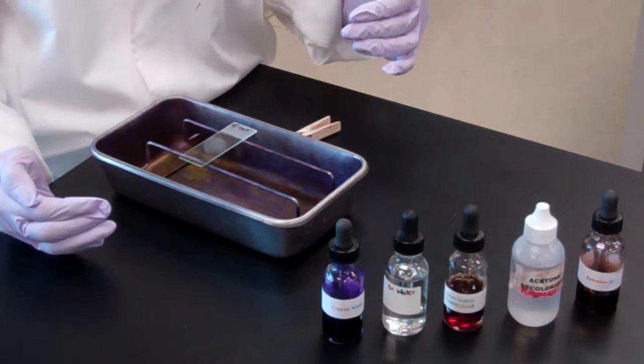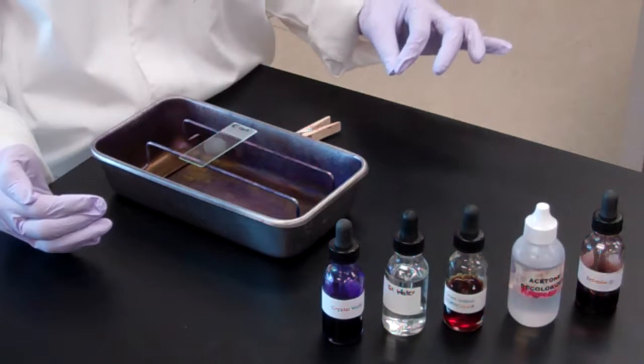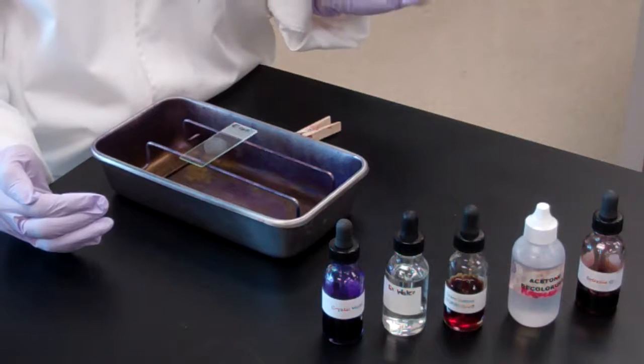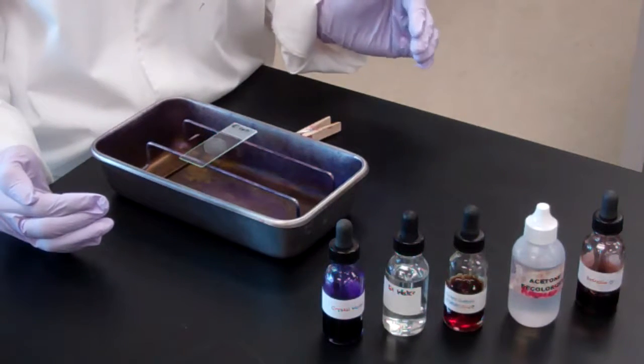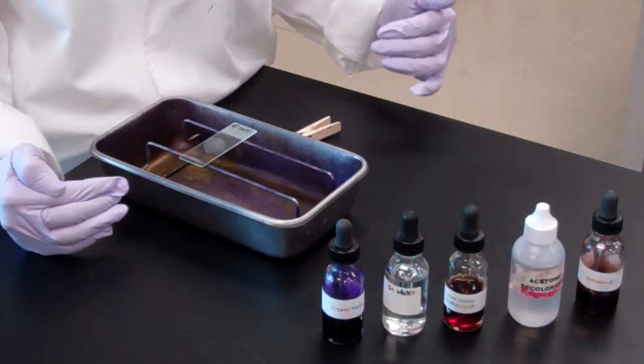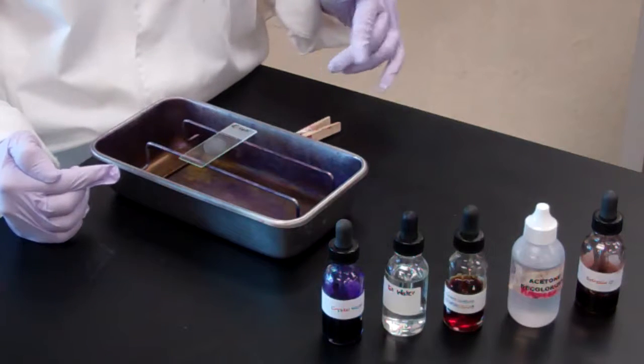The gram-negative bacterium, if you remember, has peptidoglycan, but far less of it. It has that additional outer membrane that's present on the gram-negative bacterium, and hence why, when we go through this process, you'll see it doesn't end up being purple. We'll discuss this as we go through the staining technique.